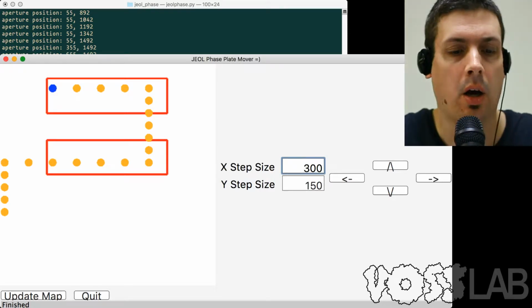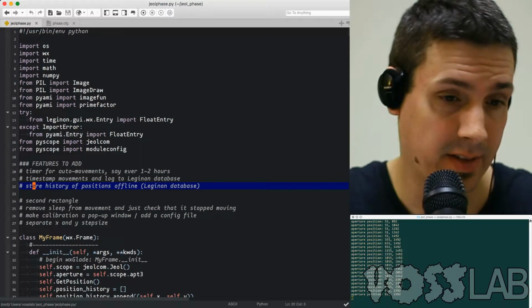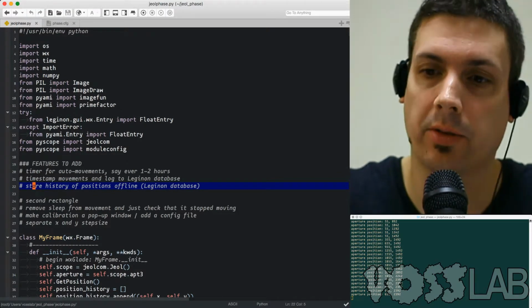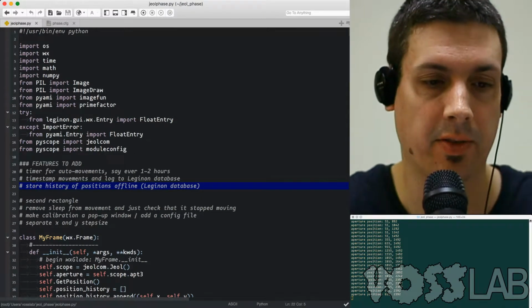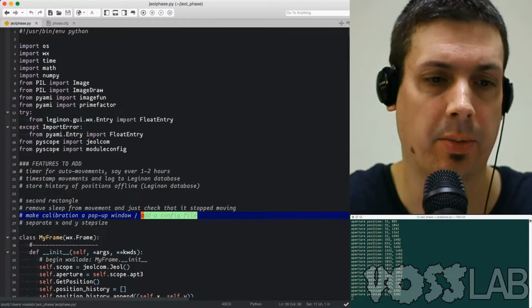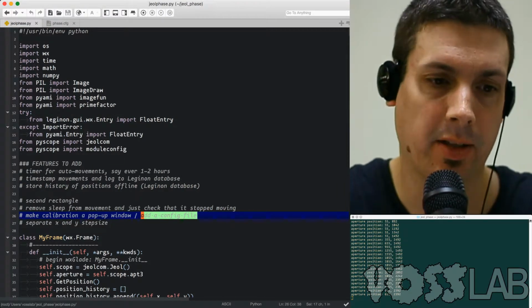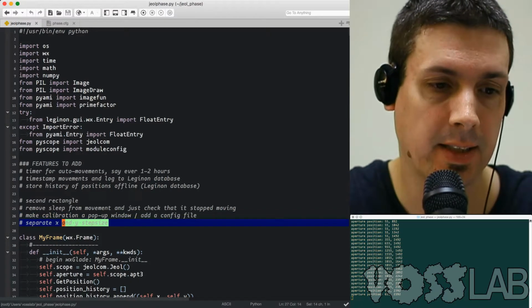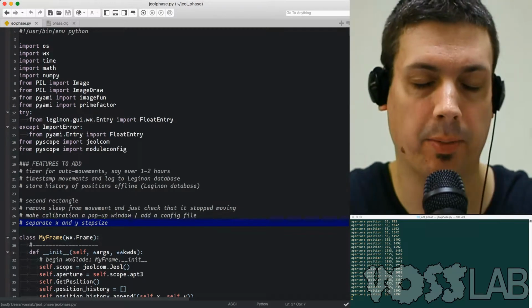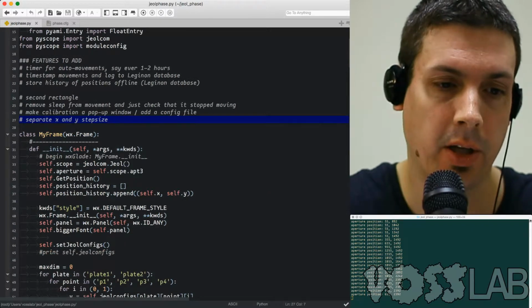In terms of features that I added, if we take a look at the code here, I added the second rectangle. I removed the sleep component, and so it just queries the microscope to see if it's done moving, which speeds up the whole moving process. I added the config file, so it's a little bit easier to configure. It's a lot easier to find the 4 corners of the phase plate than it was using that Xmin and Xmax stuff from last time. I also separated the X and the Y step size. And because I removed that old Xmin Xmax interface, it really cleaned up the code.